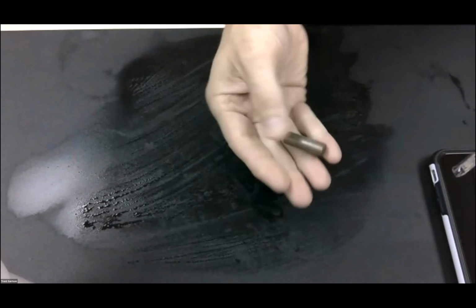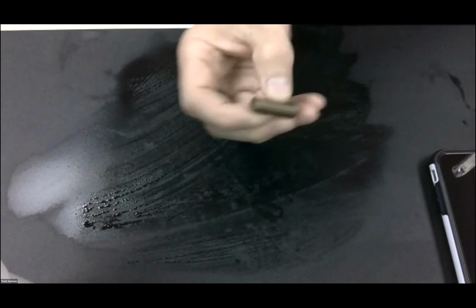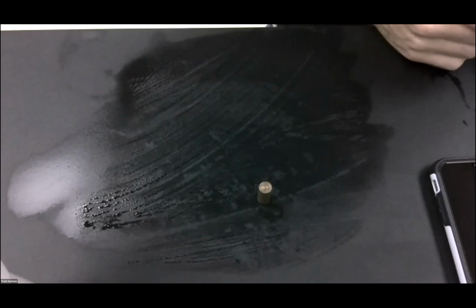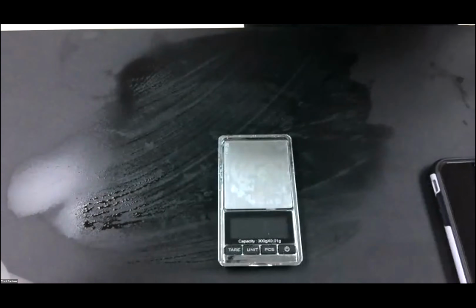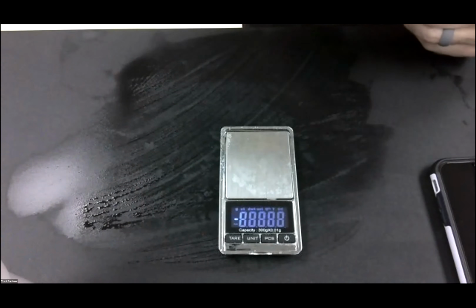And there you go. You could see it. It looks dingy. It looks dirty. And it's the piping. It's in most of our water pipes somewhere in your house, getting into the feed lines. Okay, so what we've got to do is 2 separate steps. We have to get the mass of the metal, and then we have to get the volume of that metal, and then we get the density.